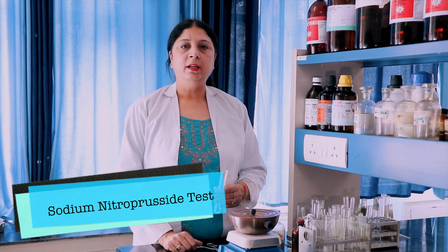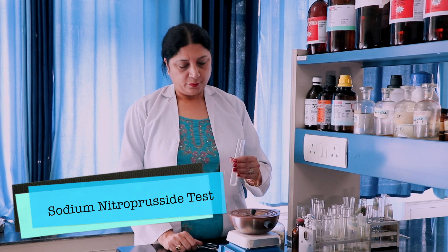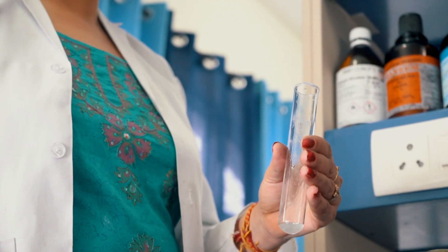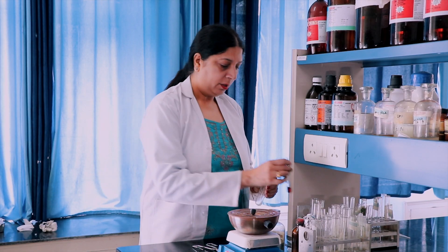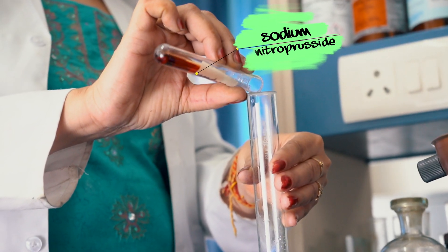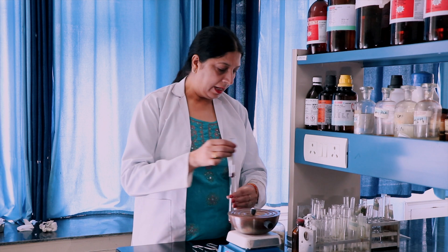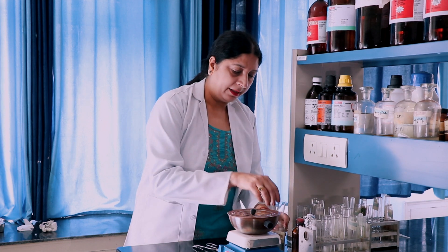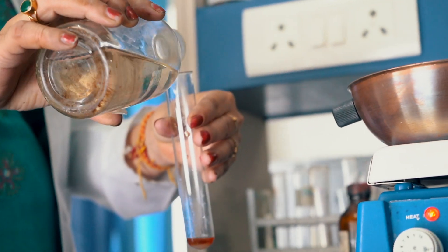To identify the ketone functional group in acetone, I have taken a small quantity of acetone in a test tube. I am adding 2-3 drops of sodium nitroprusside solution and 2 drops of sodium hydroxide solution.